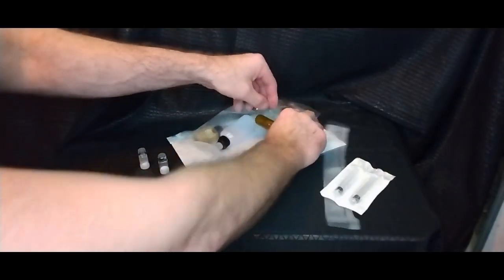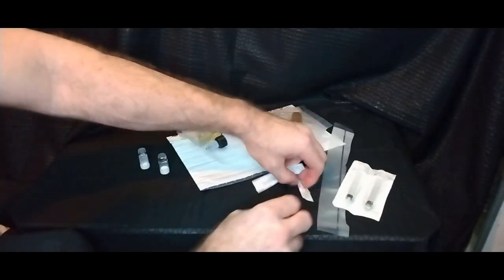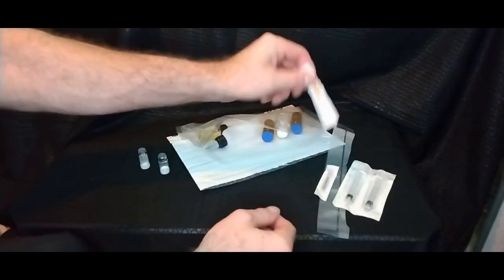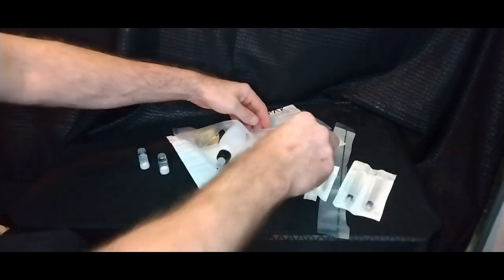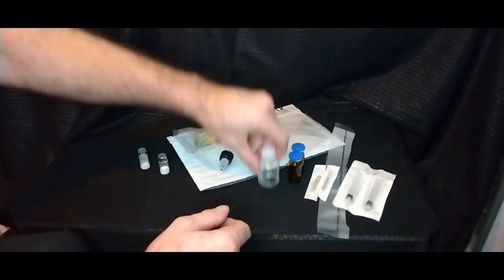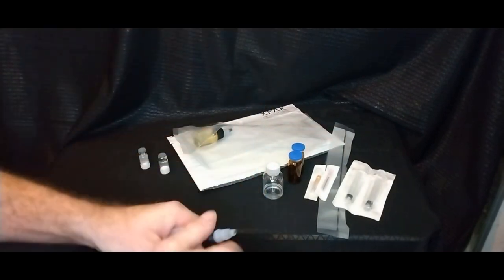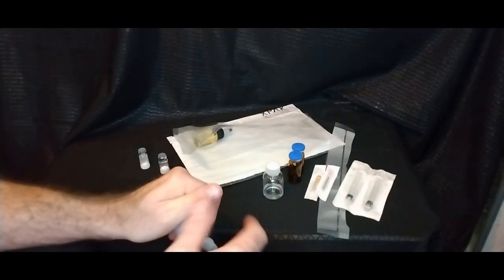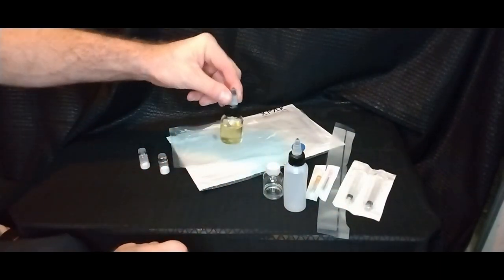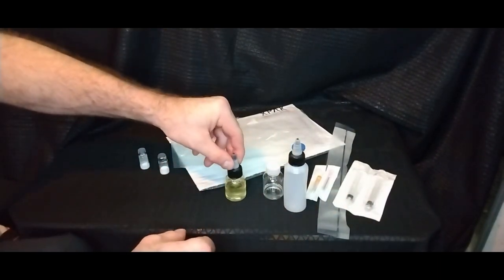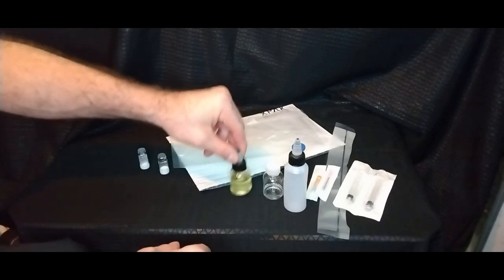What we have inside, a couple of syringes to transfer with, a drawing needle, a ventilation needle, we'll get to that in a moment, two sealed sterile amber vials, a solvent mixing bottle, a little too good a job on the vacuum, and 25 milliliters of thick, slow-releasing castor oil.